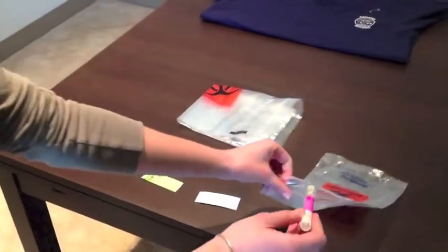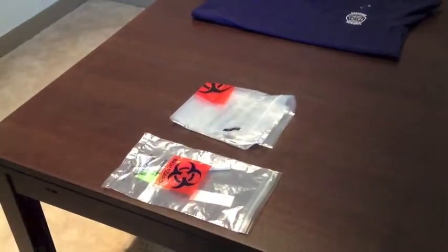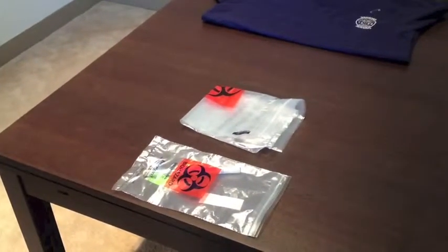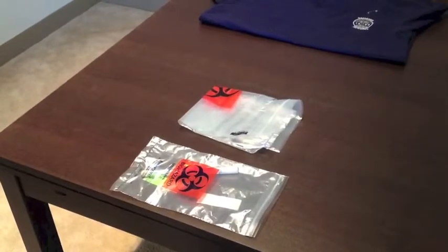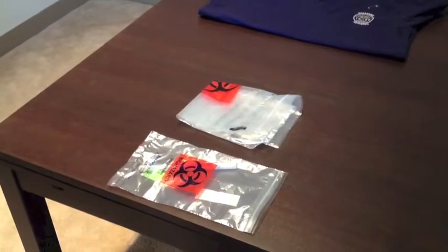Place the sticker horizontally onto the plastic tube, insert it into the smaller biohazard bag, seal it, and bring it to your Dropbox location. When submitting your post-laundering sample, fold the large biohazard bag and put both into the Dropbox. This will ensure that no biohazard bag wrongly enters the normal trash.